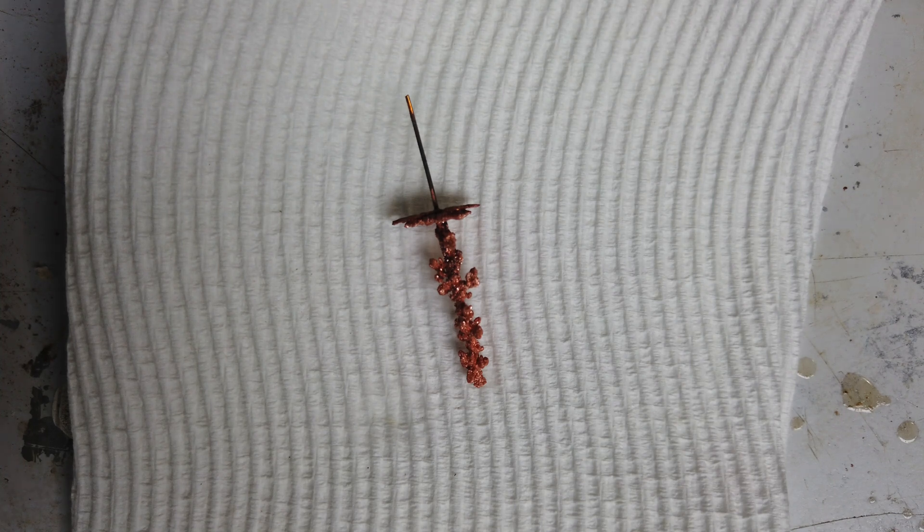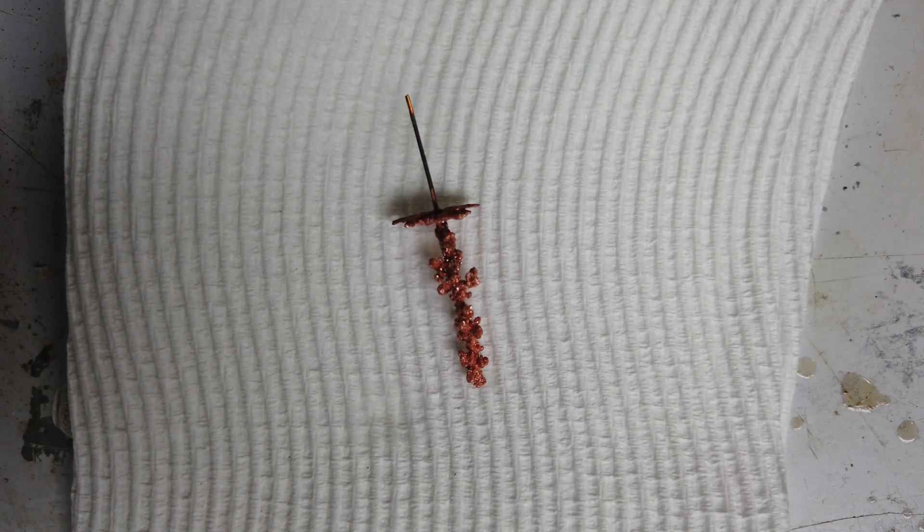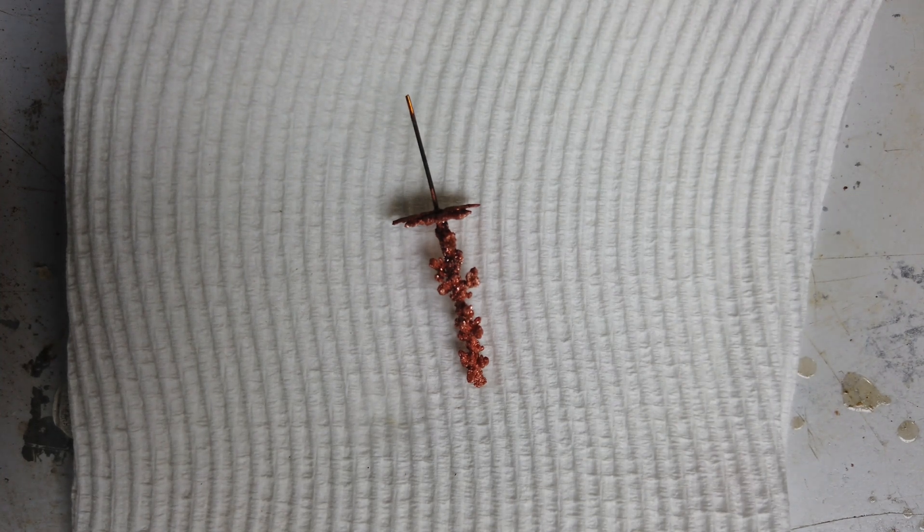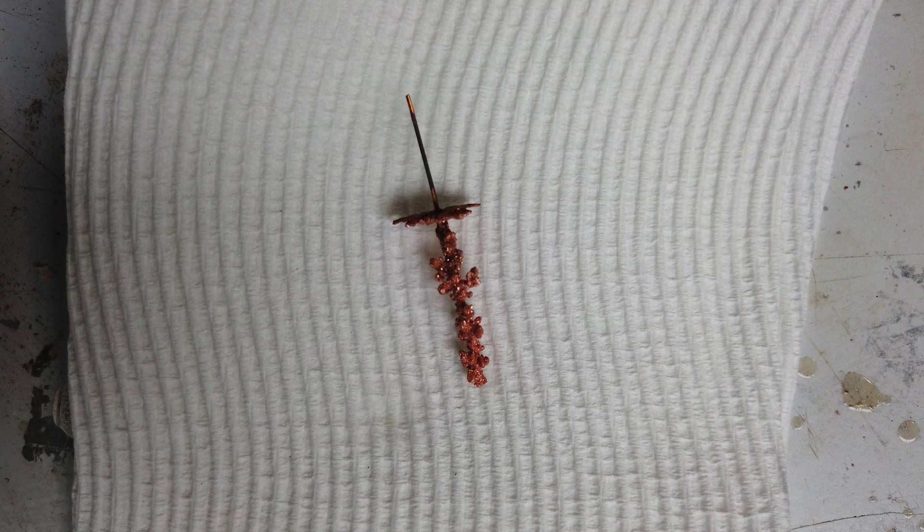I guess it's time to wash our copper deposit and then maybe seal it in an ampoule to make sure that it doesn't ever oxidize.